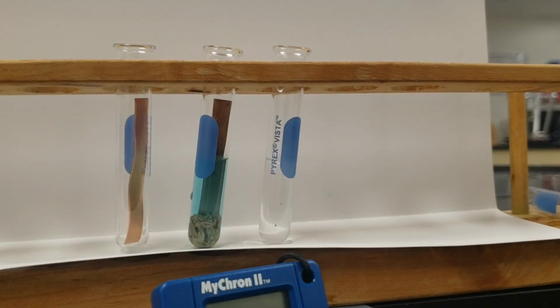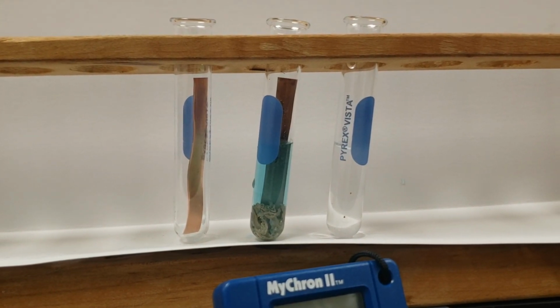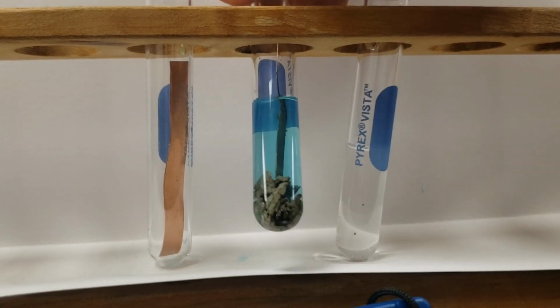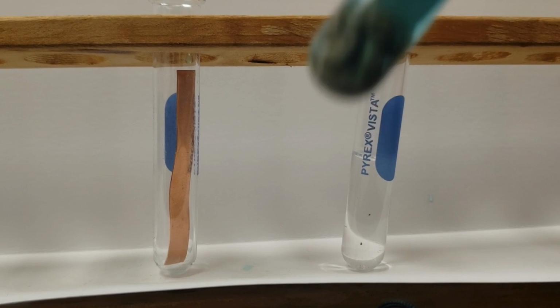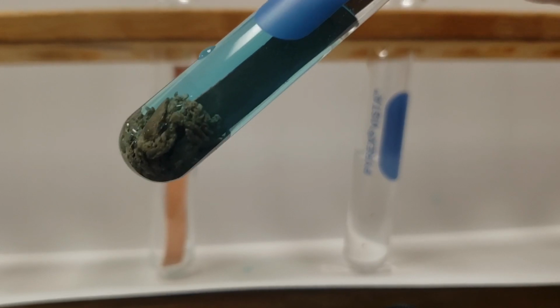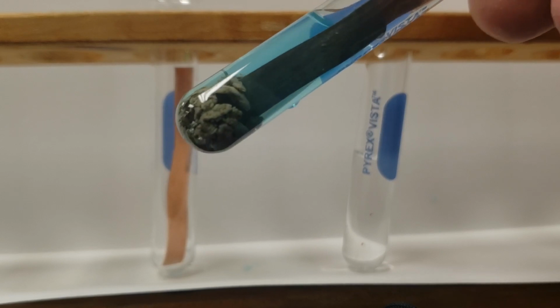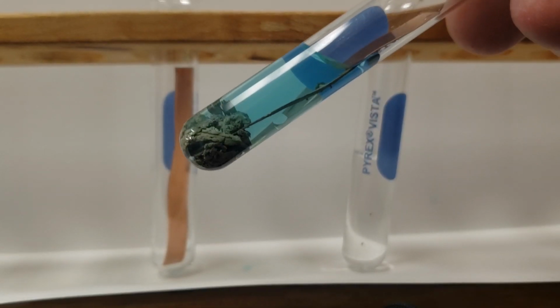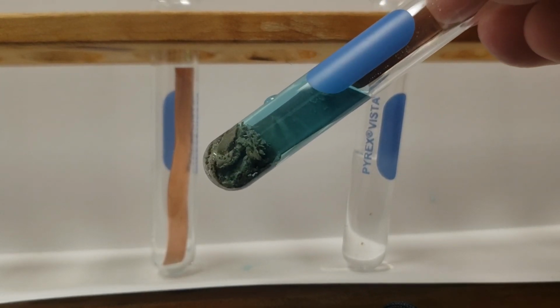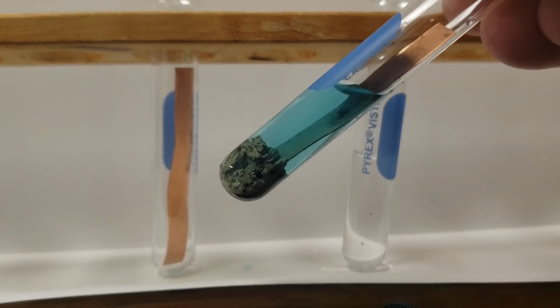Okay, so my timer shut itself off after a while. I guess it got bored, but I wanted to give you guys a closer look. I've been shaking this, trying to get the chunks off. Get a little closer look at this. You should definitely be able to see some changes here. And I know that this doesn't look super pretty, but you can see at the right angle some little spiky, silvery looking shards in there, and those are silver.